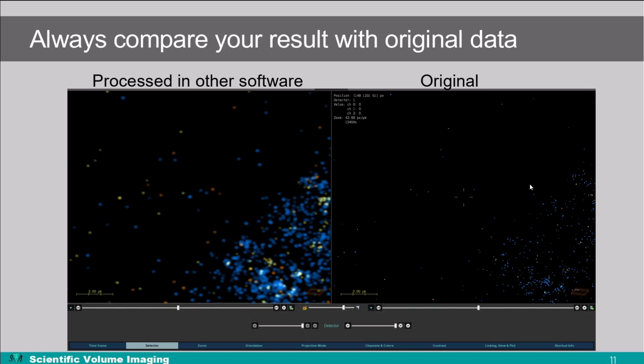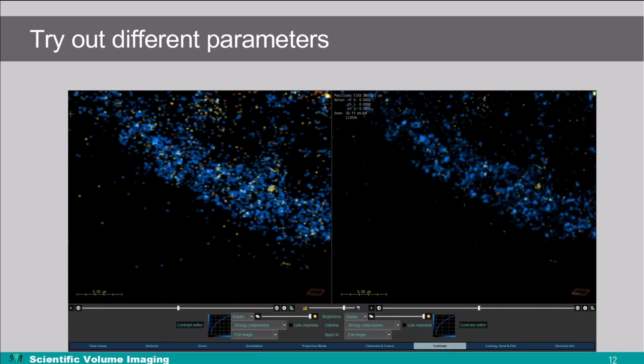And something might have gone wrong when setting parameters for deconvolution or processing, but even in the regions with more intensities it also seems off and not resembling any biological structures. So make sure you try out different parameters when deconvolving. There are tools in Huygens that can measure the background and estimate the signal to noise to distinguish the signal of your biological samples from the background.